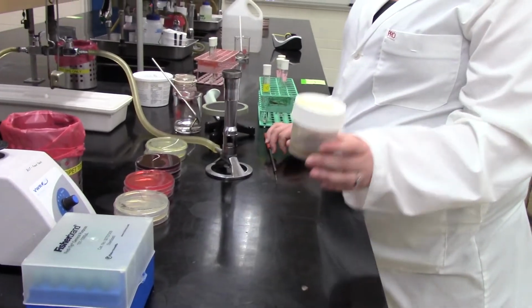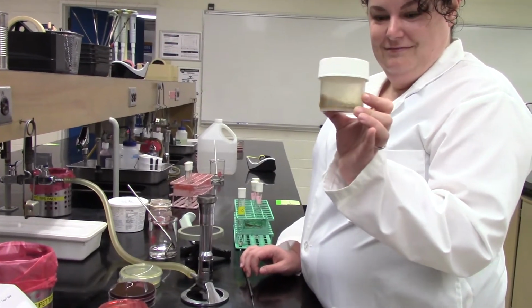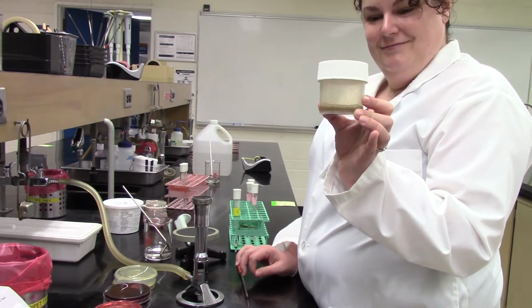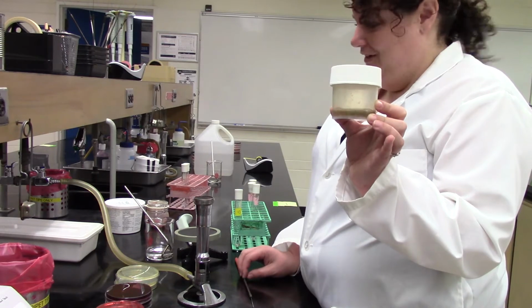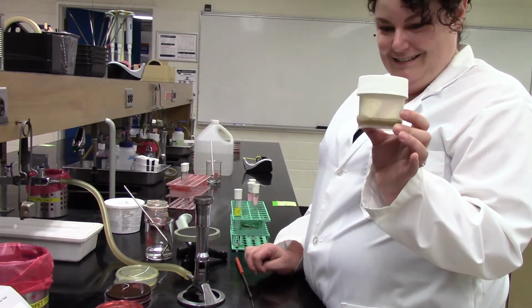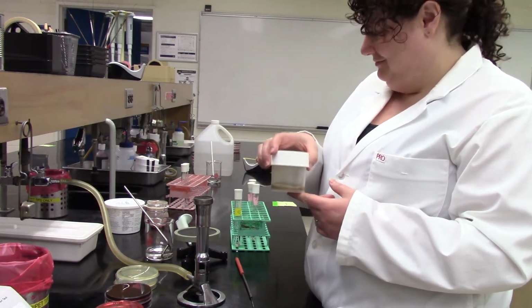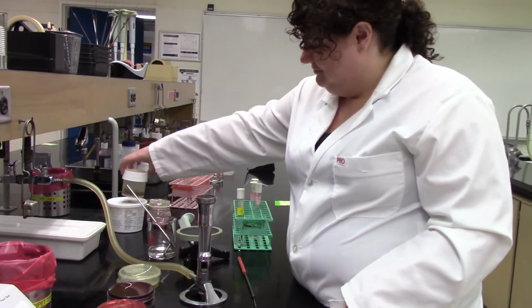And last but not least, we have, we'll call it parsley juice. So this happens when you leave parsley in the fridge for too long, which we also do purely just to create cultures for you guys. Never accidentally. No. And you've probably maybe seen this yourselves. It starts to kind of liquefy. This has had a little water added to it, and then it's left down at room temperature to enhance any kind of microbial growth as well.